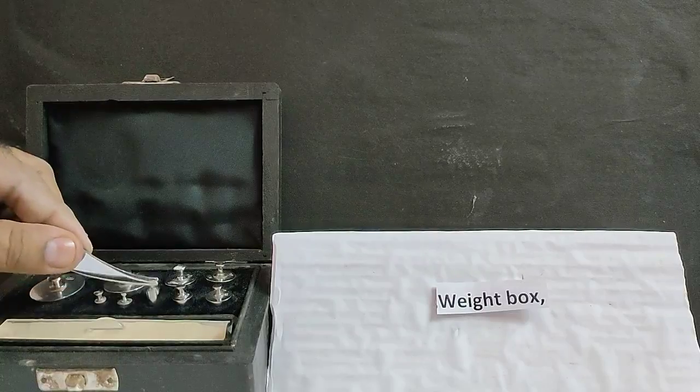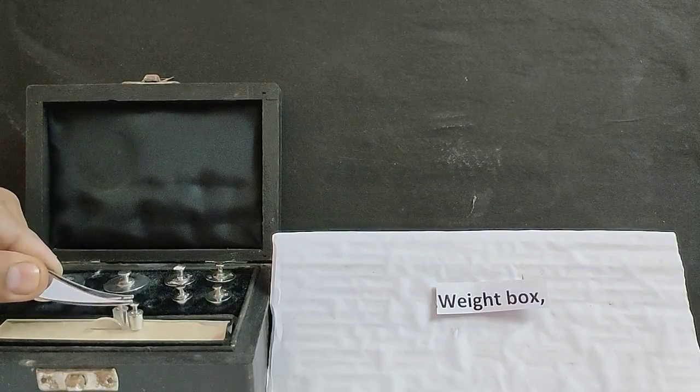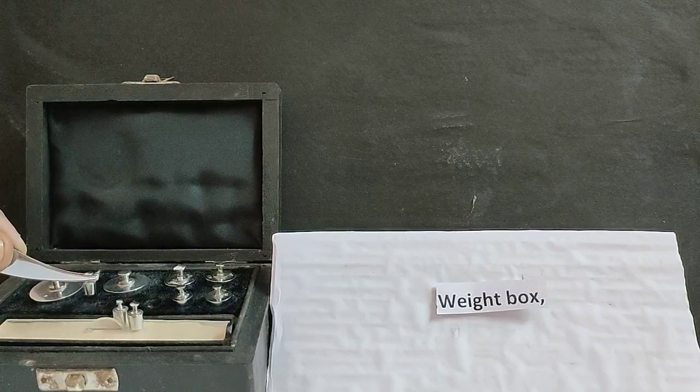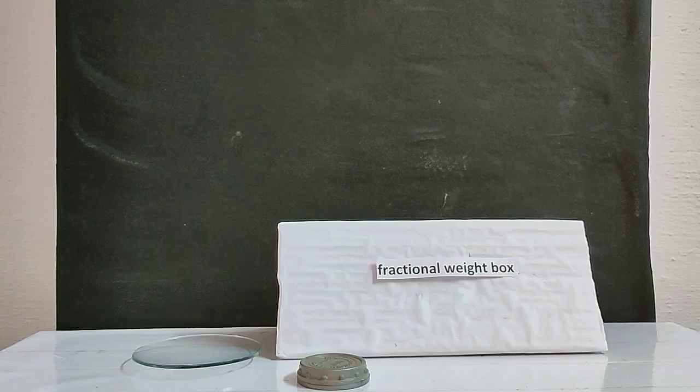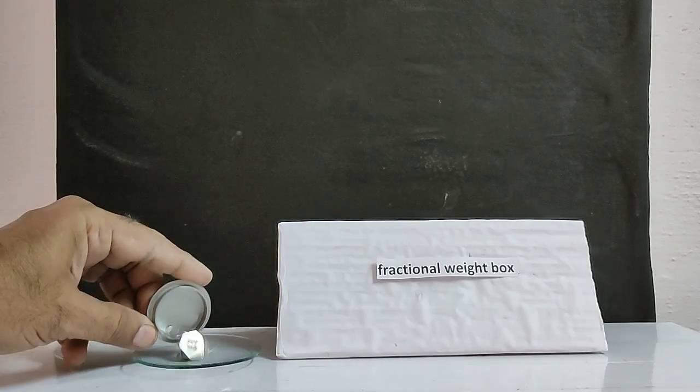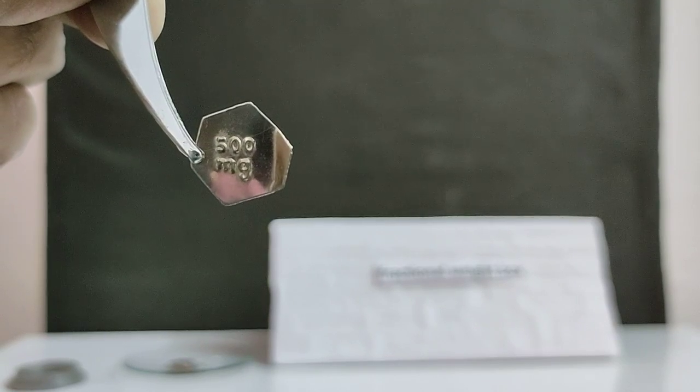One weight of 5 gram, two weights of 2 gram, and one weight of 1 gram. Fractional weight box with weights in milligrams: 500 mg hexagonal in shape.